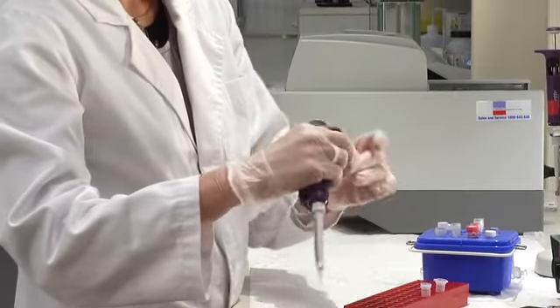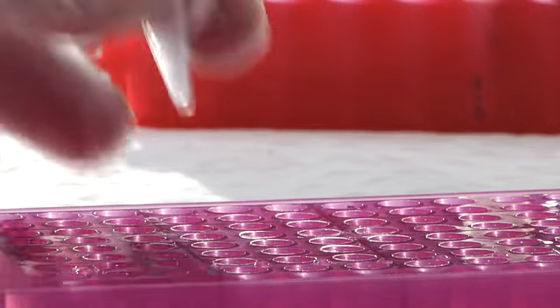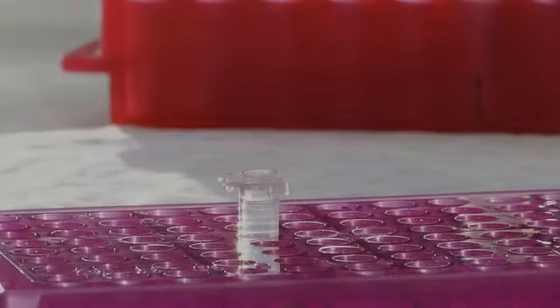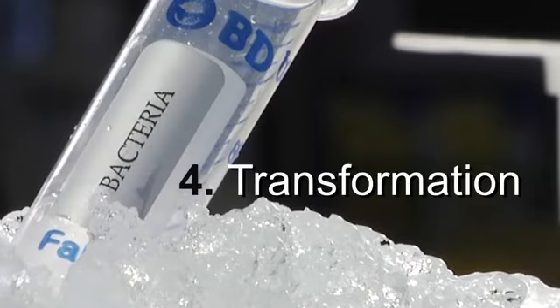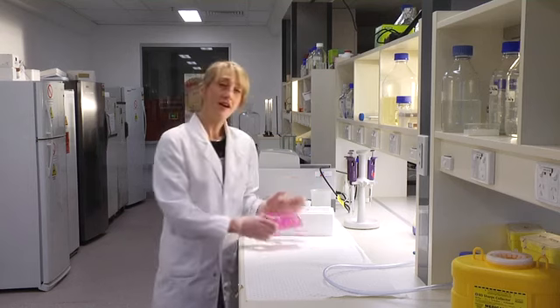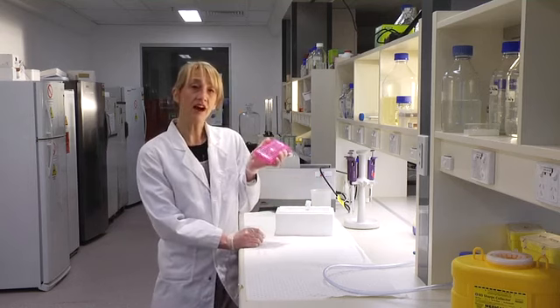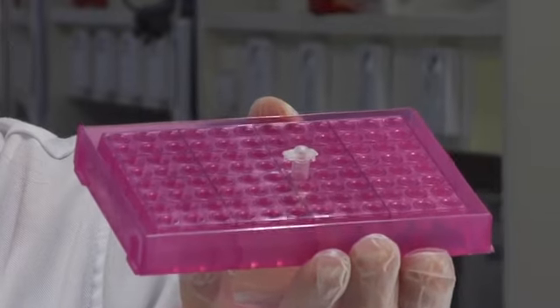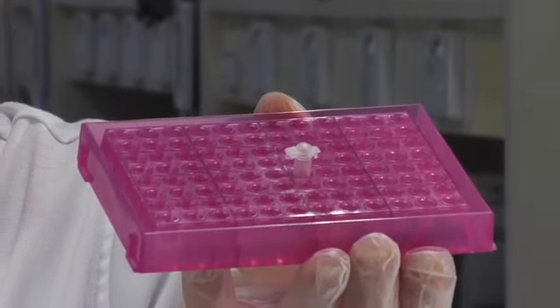And now we just leave the reaction overnight and let ligase do its thing. Now that we've incubated this overnight, our ligation should contain some plasmid molecules with the insert in it.